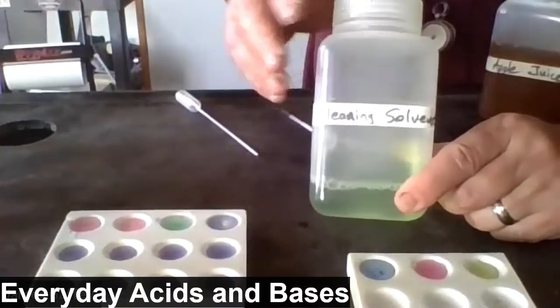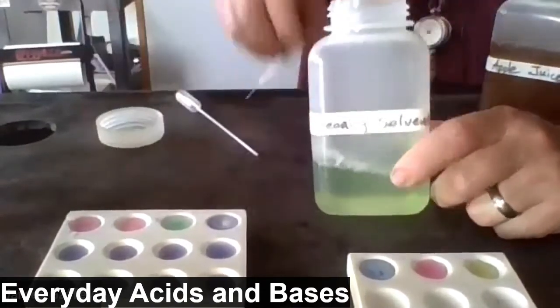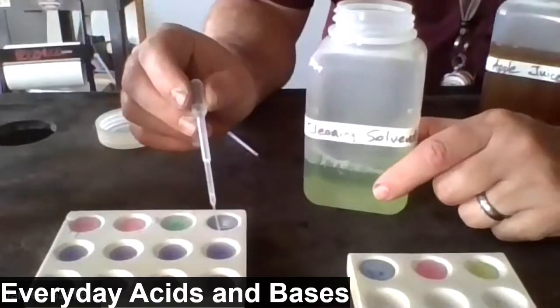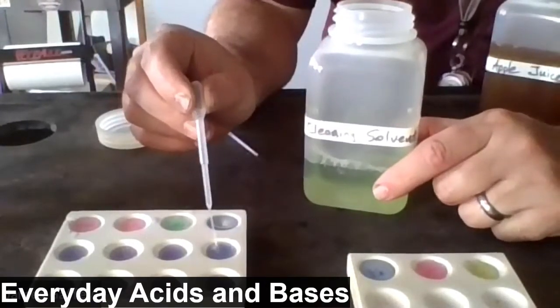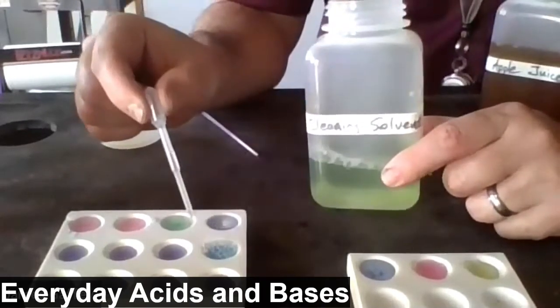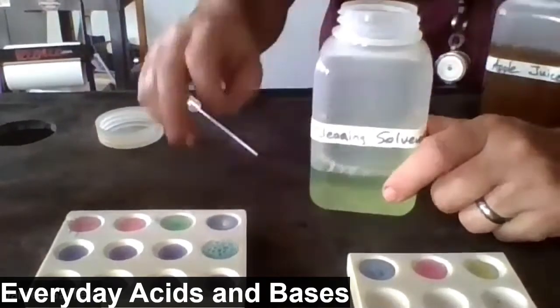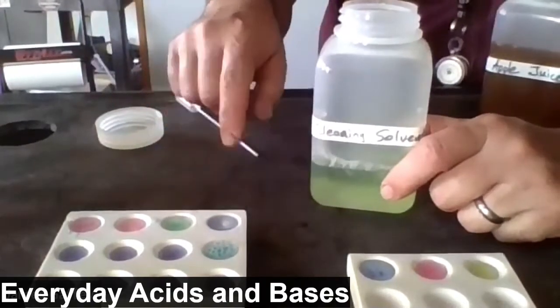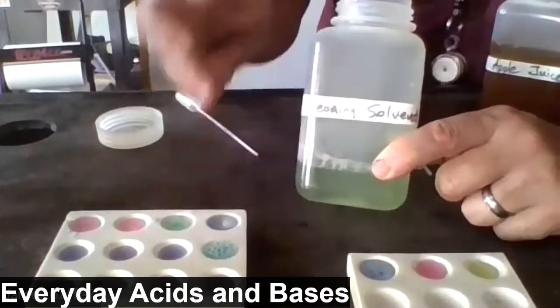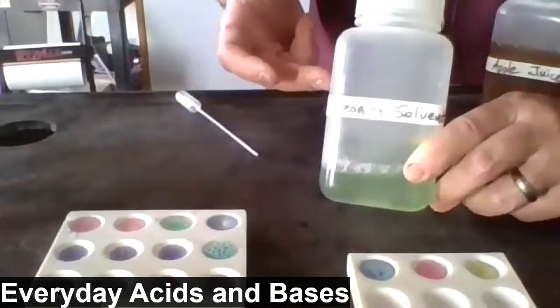Cleaning solvent. This is like 409, stuff that you would put on your kitchen surfaces to make them clean. I'm going to add the 409 to this well, so middle row. It's very bubbly. We see the same color change as we saw with the ammonia cleaner. So both the cleaning solvent like 409 and ammonia have a similar reaction, which might lead us to conclude that this is a base.